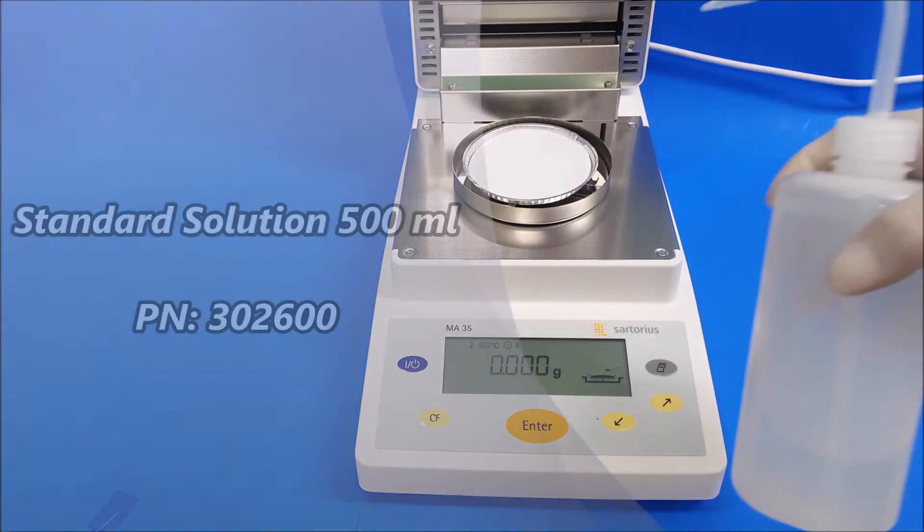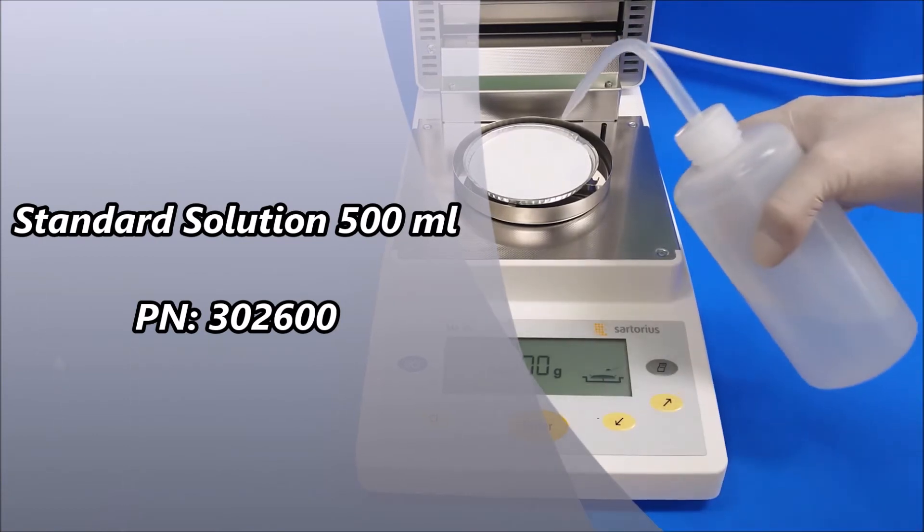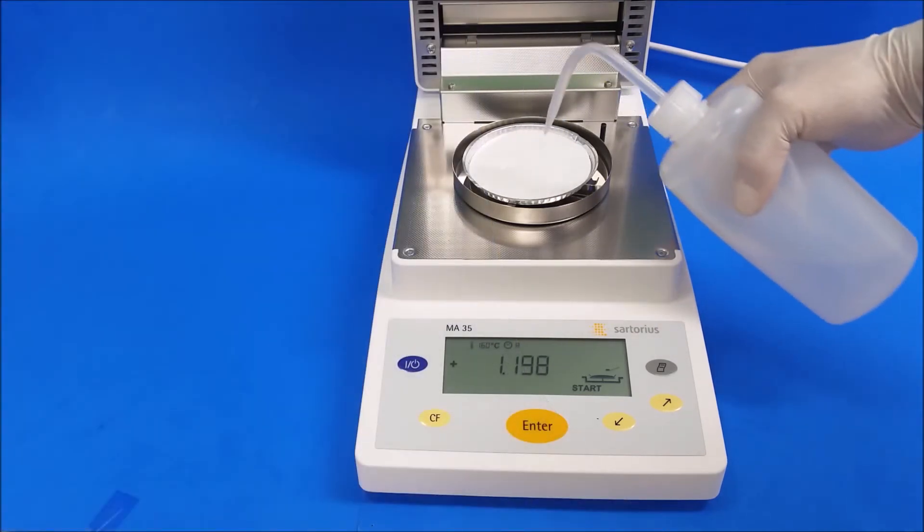I'm going to add standard solution. Here's the liquid form that we have. I'm adding 2.5 grams.